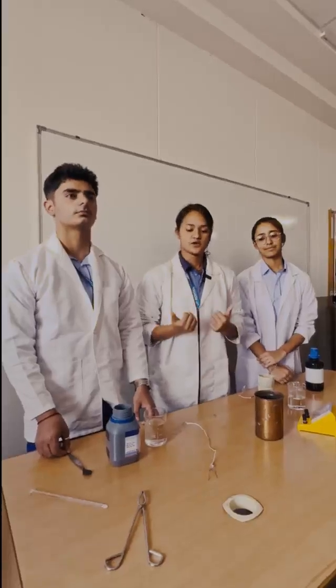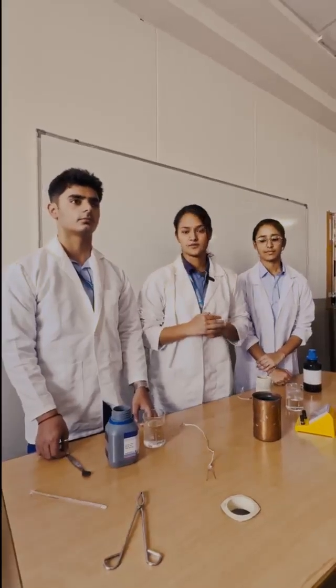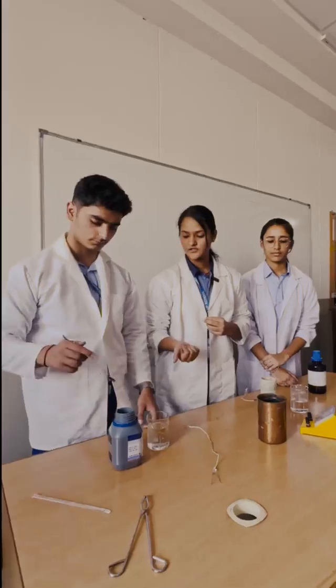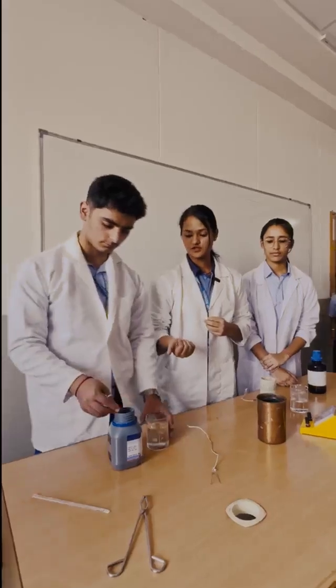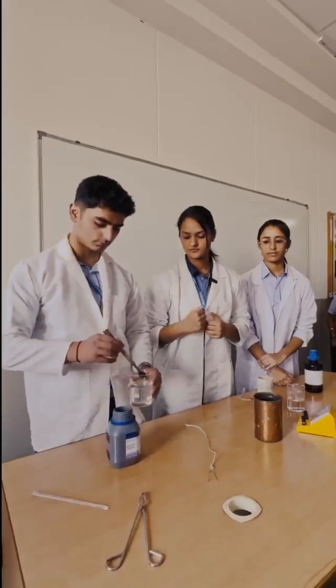Hello everyone, today we are going to make an electrochemical cell. First of all we have a copper sulphate solution, aqueous copper sulphate solution.